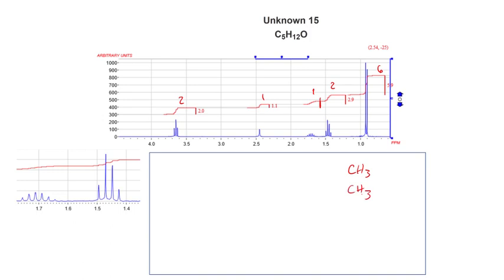Now I might notice that they're split by 1 hydrogen. I'm not going to use that information right now. Okay, we have a CH2. We have a CH. Looks like we have another CH around 2.5, and we have a CH2. Okay, let's check, see what we've got. Hydrogens: 3, 6, 8, 9, 10, 12. That's good. Carbons: 1, 2, 3, 4, 5. Okay, I made a mistake. I made a hypothesis statement that's not consistent with the data. I only have 5 carbons. What's the deal?